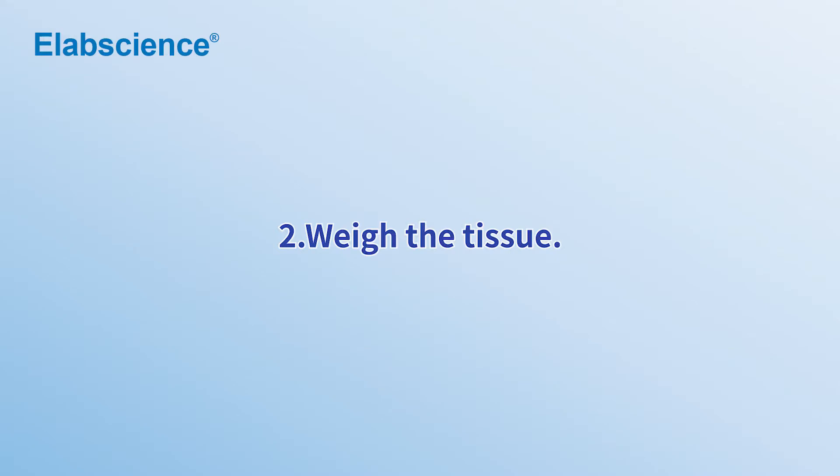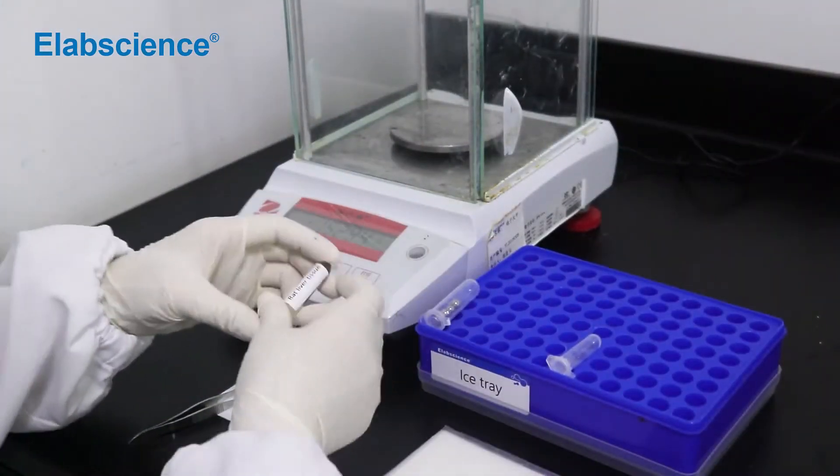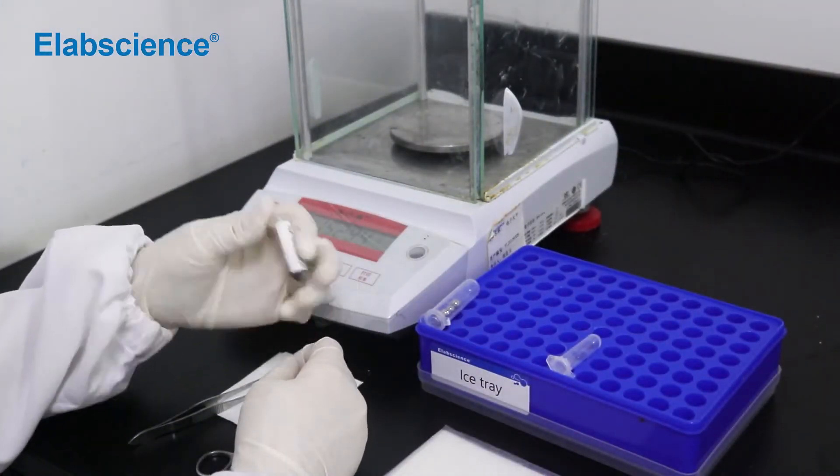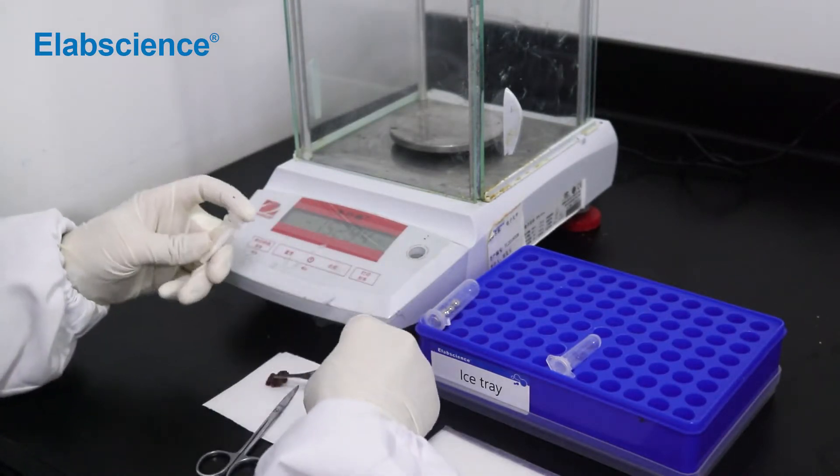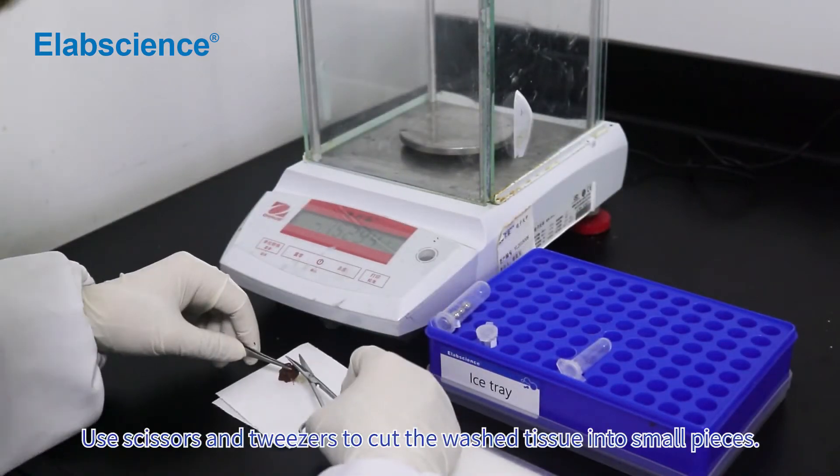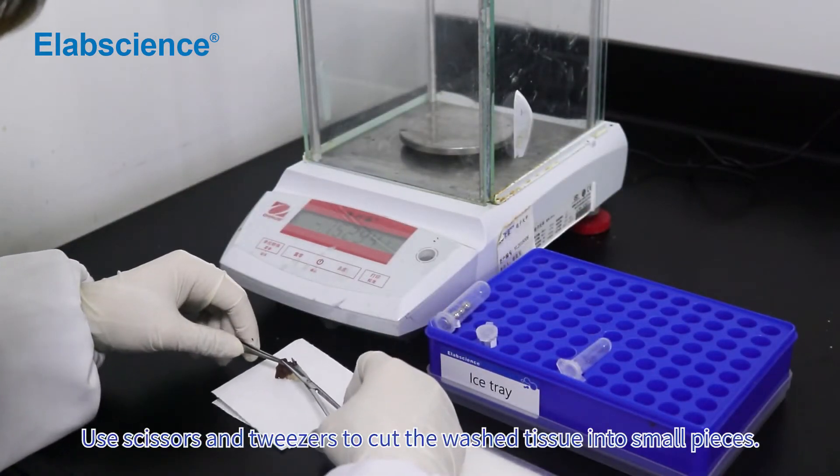Wash the tissue. Weigh the tissue. Use scissors and tweezers to cut the washed tissue into small pieces.